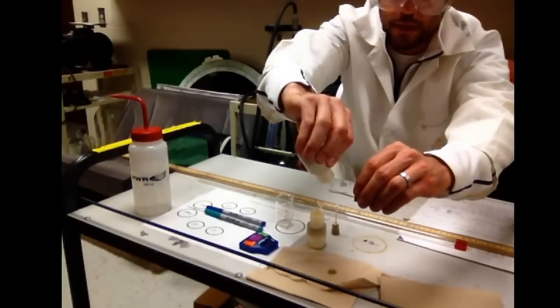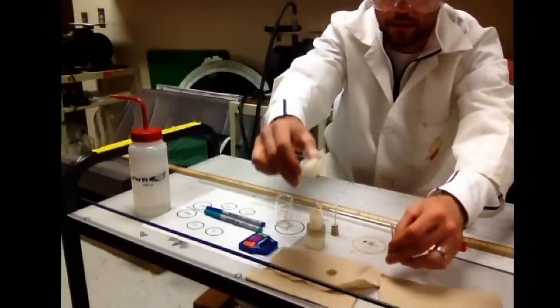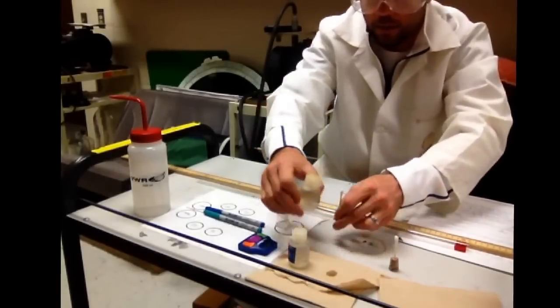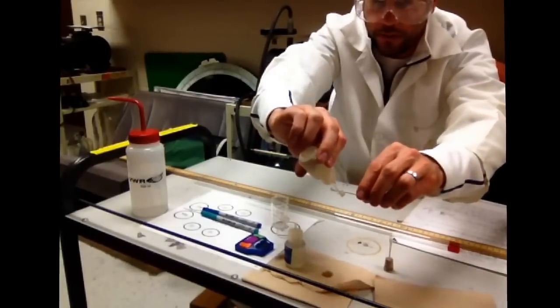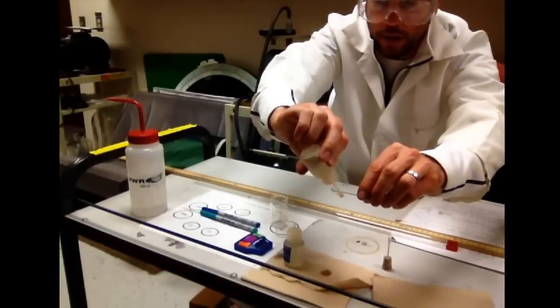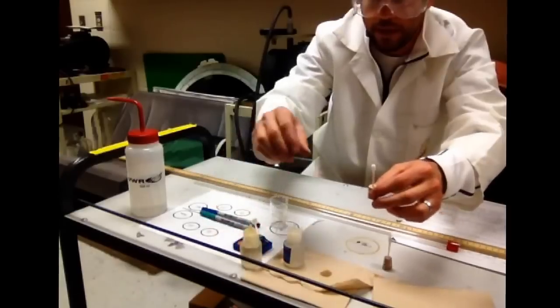I'm going to go ahead and put a few drops of it. One, two, three. Sounds good. And then one, two, three of the hydrochloric acid. So I've got three drops of each.